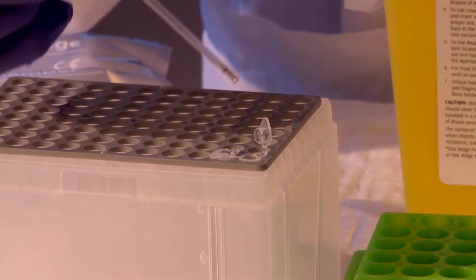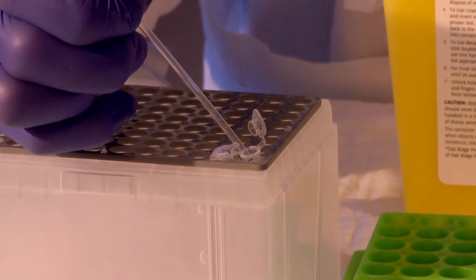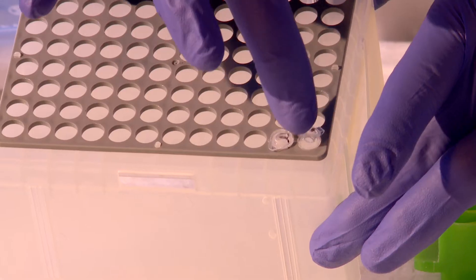Add the DNA to the appropriate tube containing the pellet reagents. Make sure that the entire content of the capillary tube has been emptied into the PC-RUN reaction tube. Close the lid.